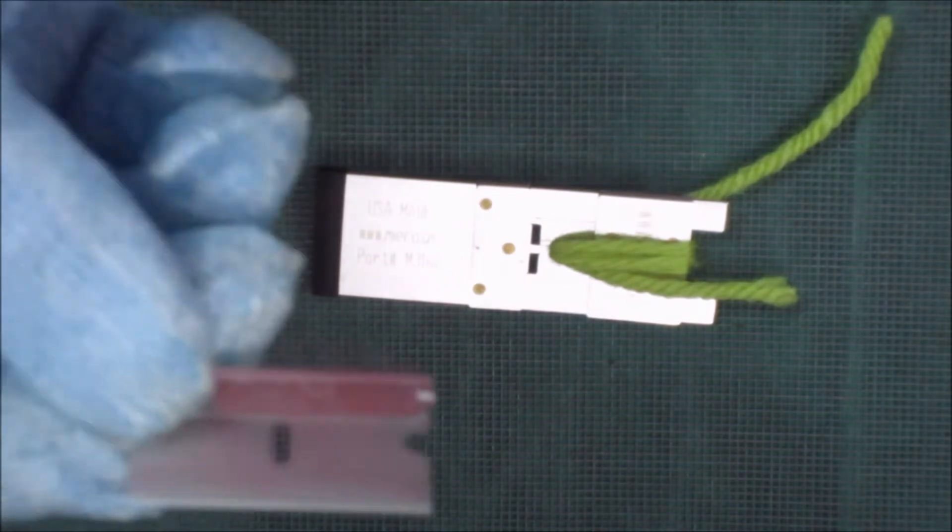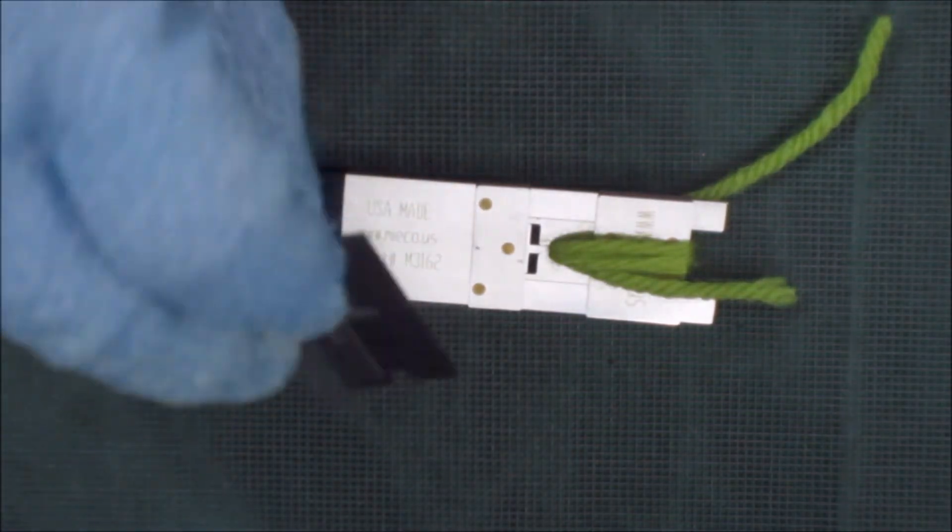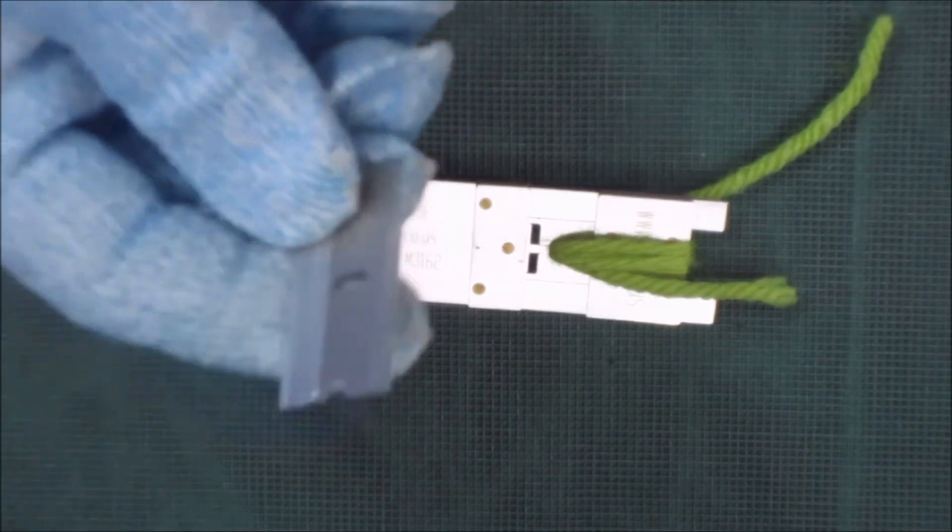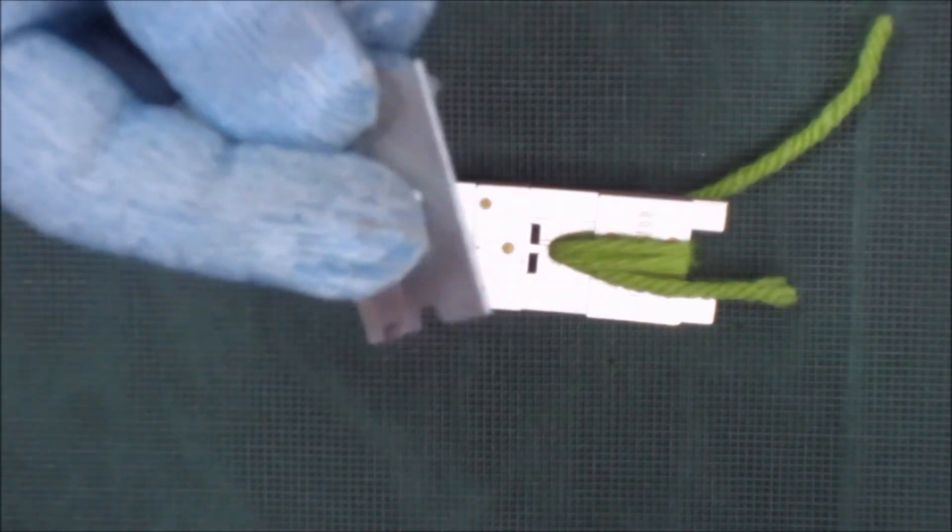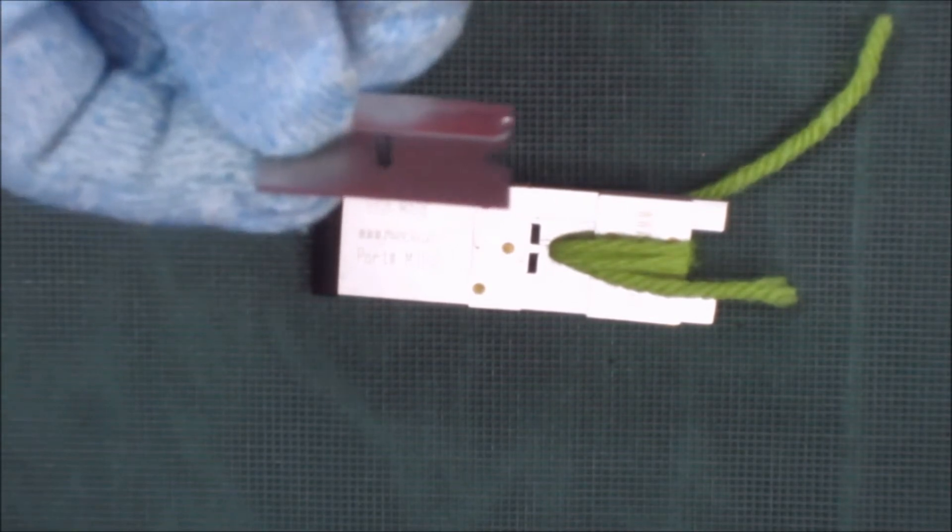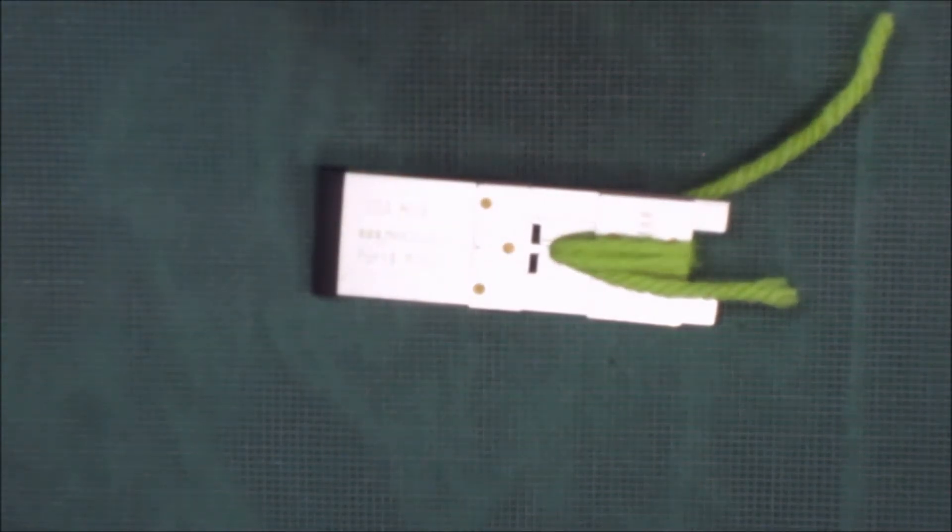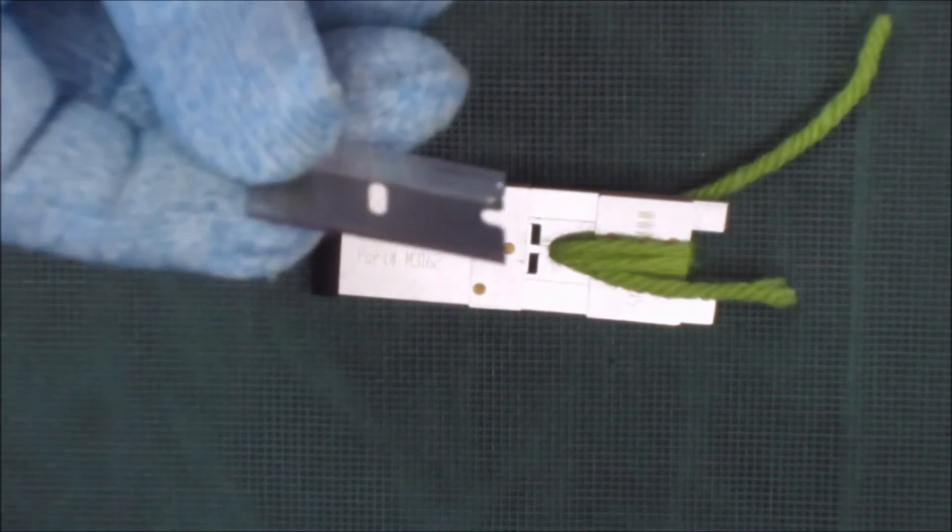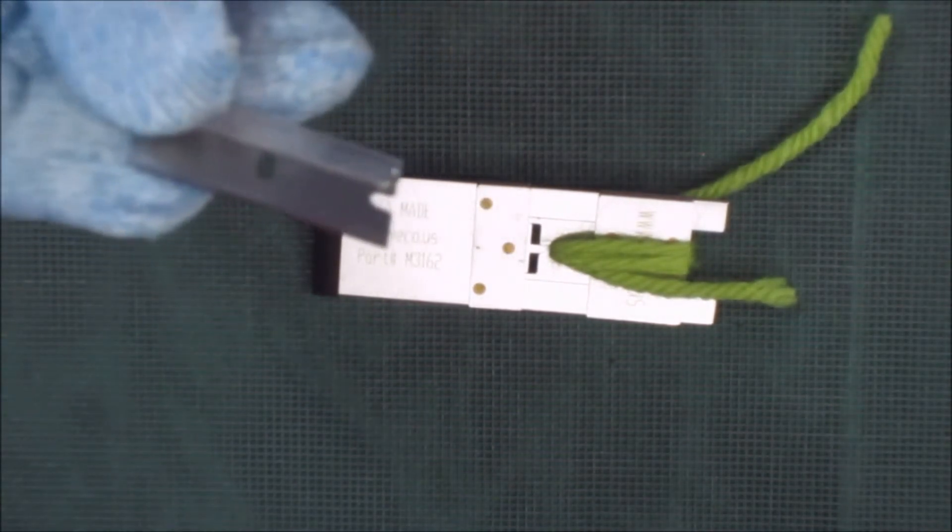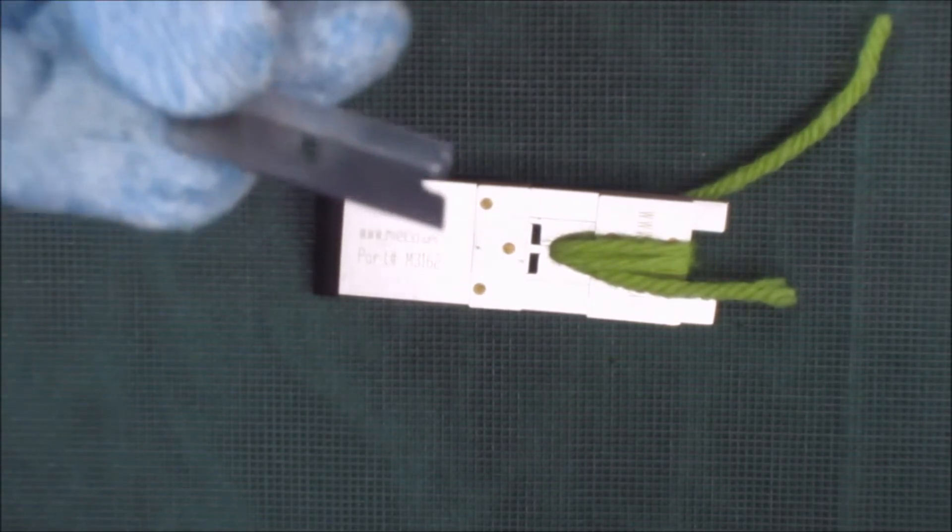Now the razor blade is a single edge safety razor blade. What's critical about the razor blade is that you only use one per sample. You start out with a brand new razor blade. Once this sample is cut, you throw the blade out, not to use it again, because if you do, you're going to get bad results.